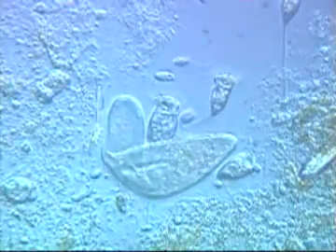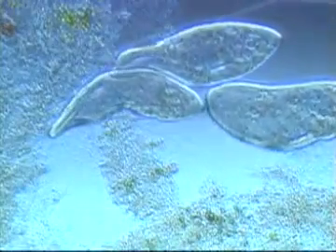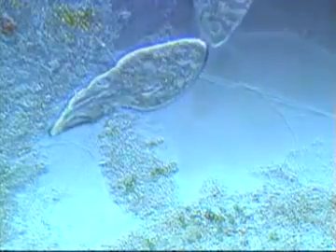Paramecium moves by beating its cilia and spinning its body in a spiral motion. In open water, it can reach remarkable speeds. It is one of the fastest protozoa. In tight spaces, a paramecium is able to bend its body back on itself in order to make a sharp turn. They can distort their bodies to squeeze into narrow channels. They can contort their body so much it can be difficult to tell what they are.